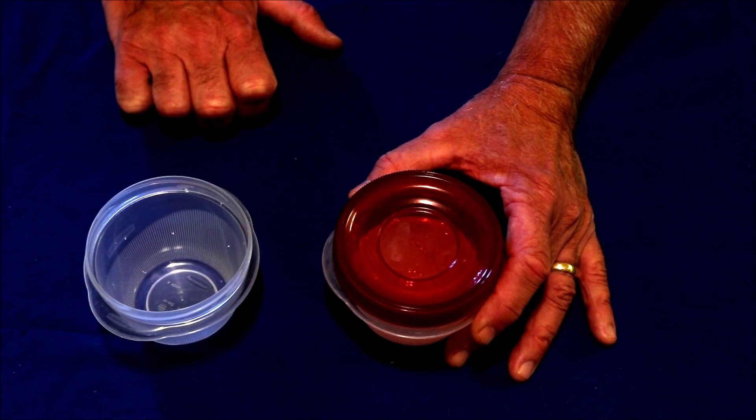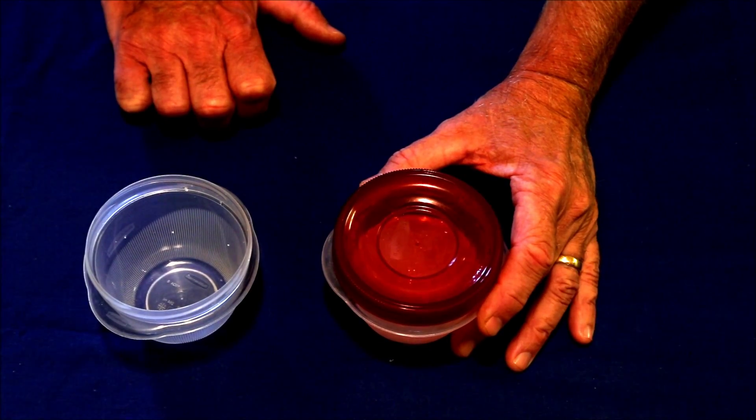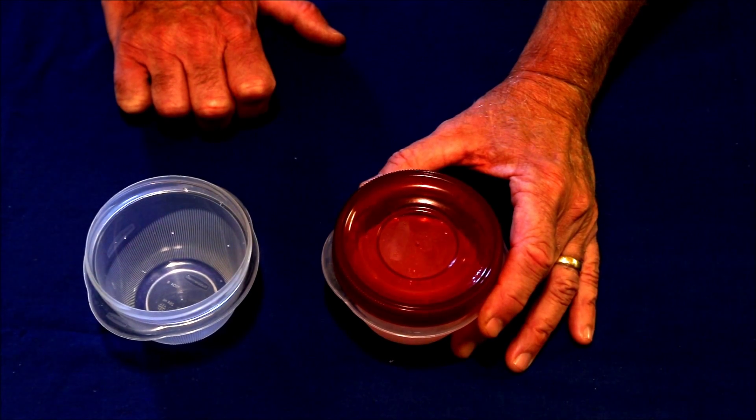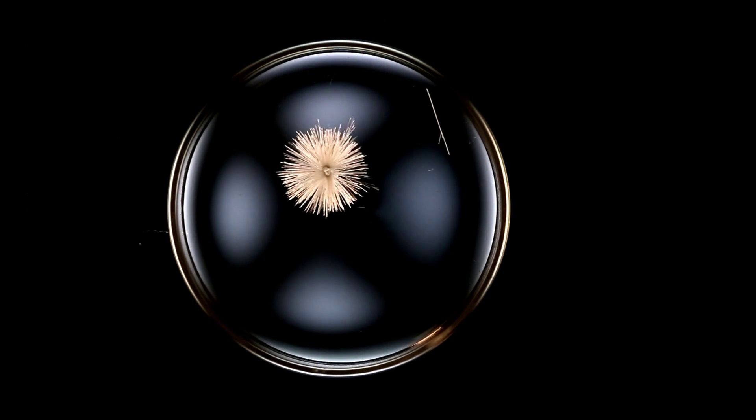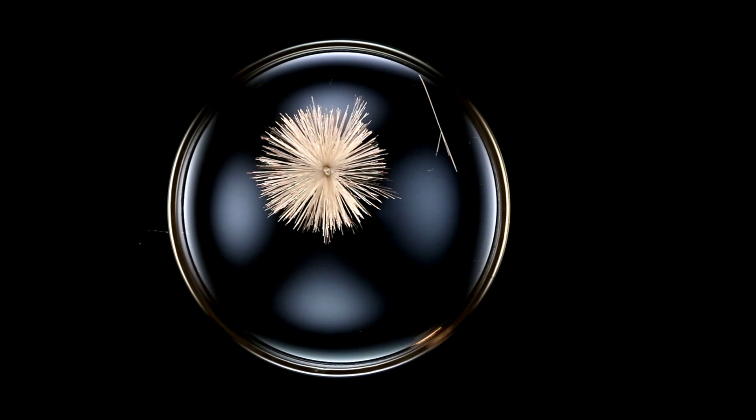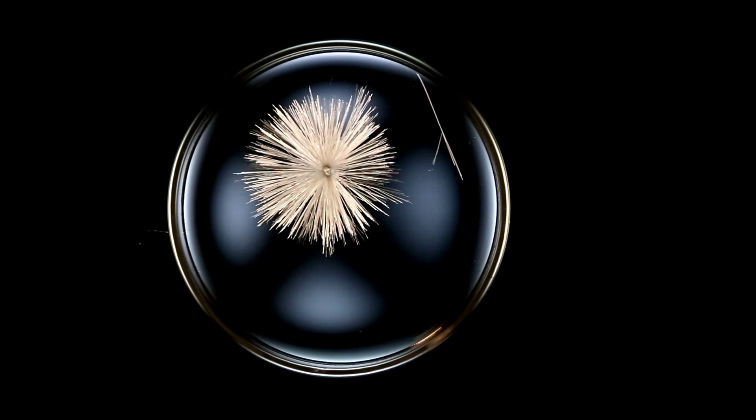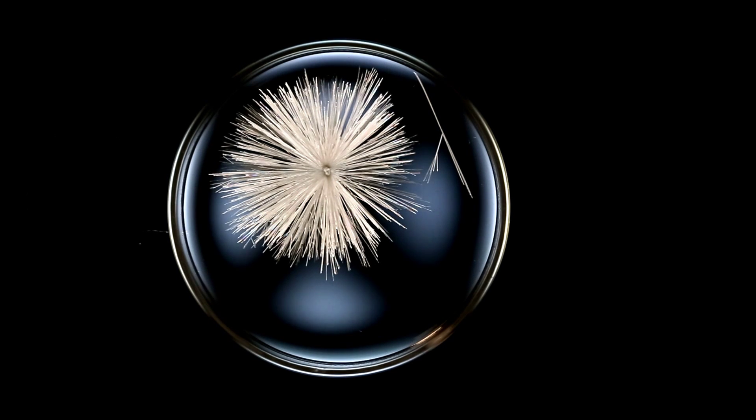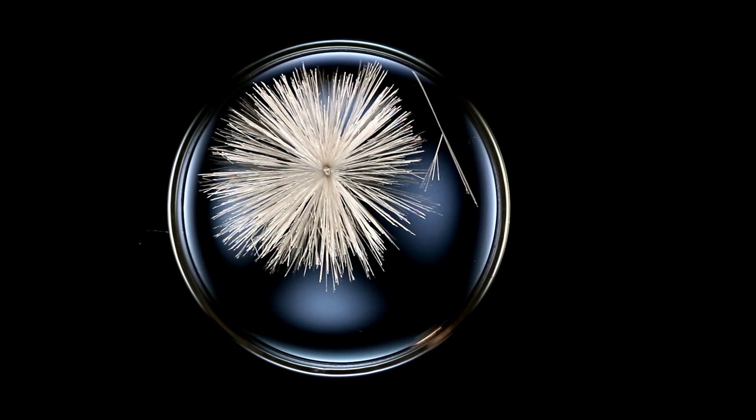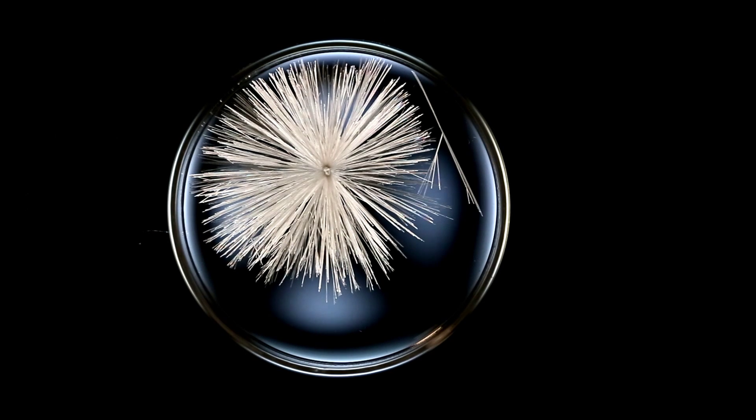Let's look at some examples of how concentration affects crystal growth speed. This first example is of a 2:1 ratio of sodium acetate to water. It grows very slowly and provides the best view of what the individual crystals look like. This ratio is probably the best for classroom demonstrations, allowing students to get an idea of what the shape of the crystals are. All the videos of the crystals growing are shown in actual time—they haven't been sped up or slowed down.